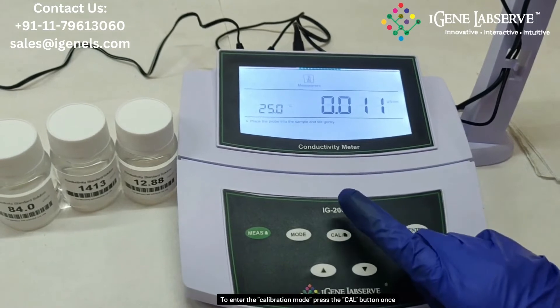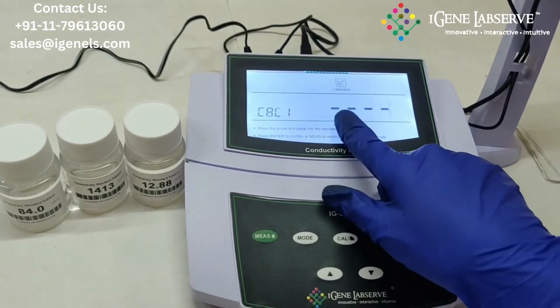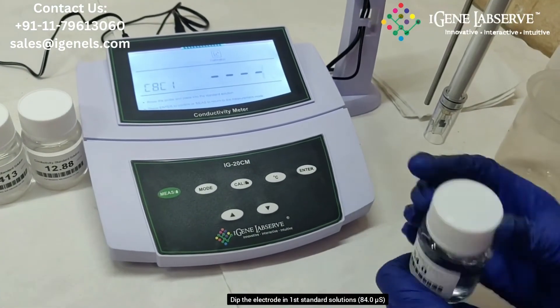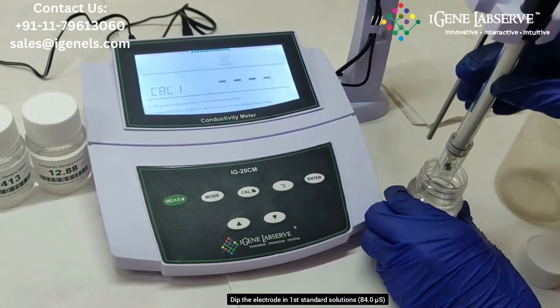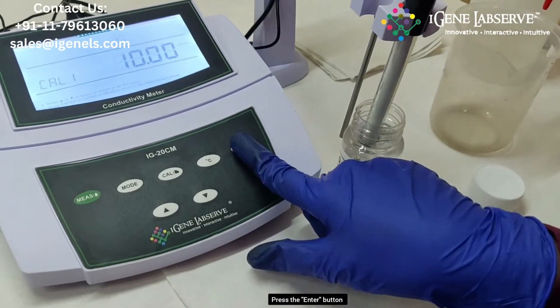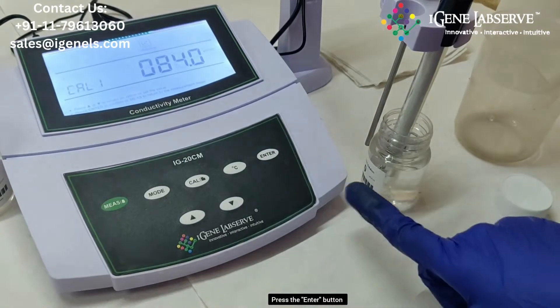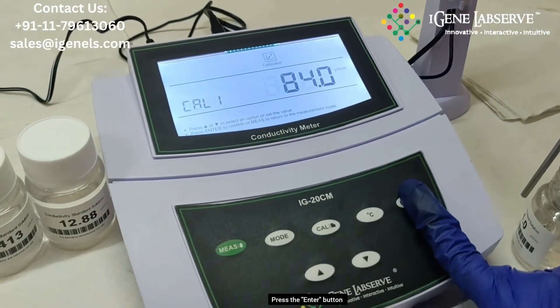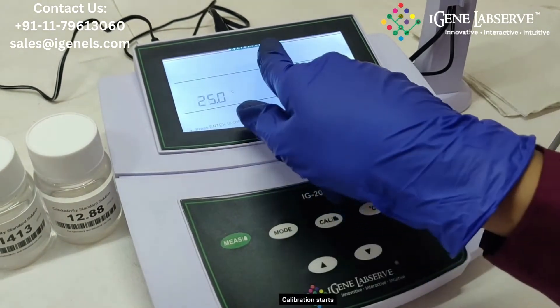To start calibration, single press the cal button — it goes to calibration mode. Take the first standard solution and place the electrode in it. Press the enter button when the display shows the current standard solution value and the calibration starts.